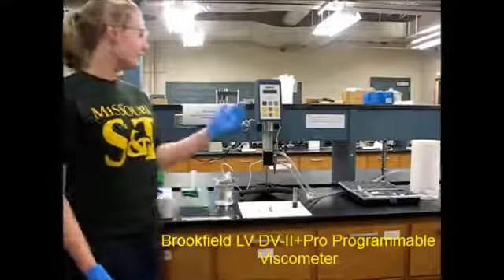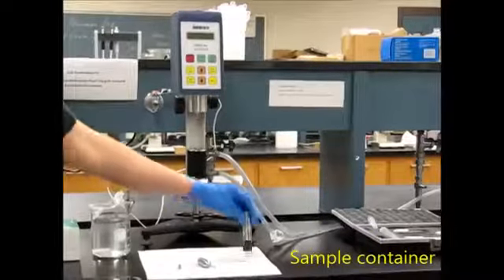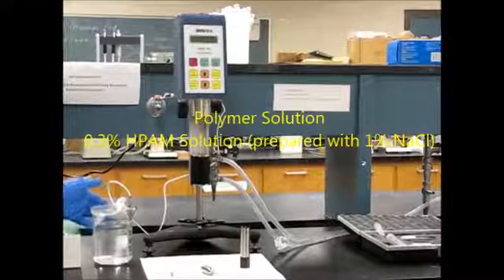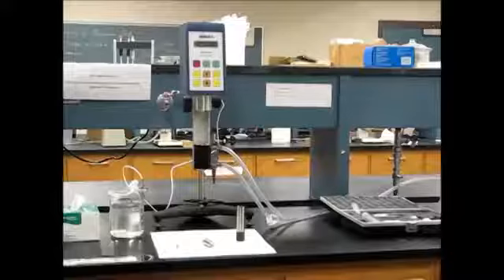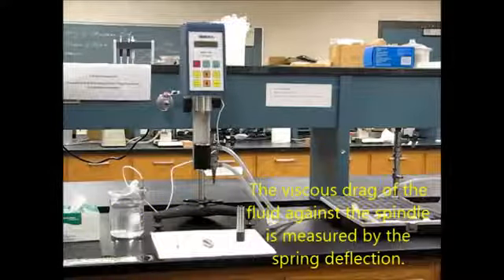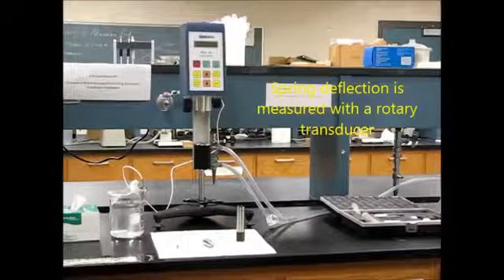The equipment required is this viscometer, the spindle, the sample container, the guard leg, the polymer solution, and a 600 milliliter beaker. The principle of operation of this viscometer is to drive a spindle through a calibrated spring. The viscous drag of the fluid against the spindle is measured by the spring deflection. Spring deflection is measured with a rotary transducer.